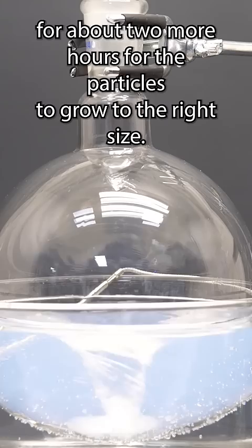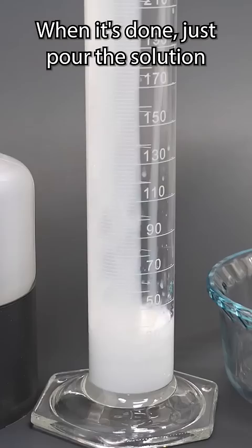Over the next few minutes, the solution goes from opalescent to opaque white, but we have to let it cook for about two more hours for the particles to grow to the right size.